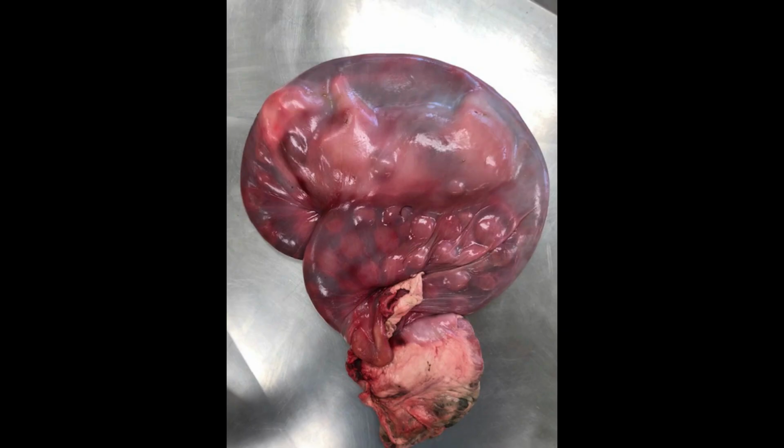And here we have a gravid uterus, which means a pregnant uterus, and you might just be able to see at the top the fetus, and this is a cow, so it's a little fetal calf, and below that you see a lot of little ball-like structures. These are the placentomes, the sites of placental attachment between the actual fetus and the mother's uterine lining to form the blood connection between the two.